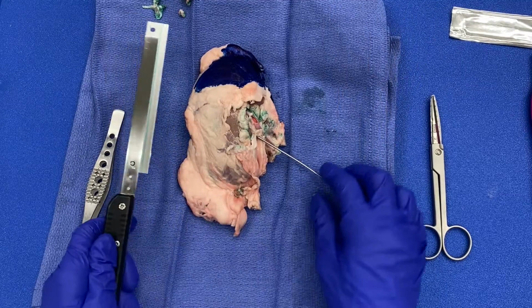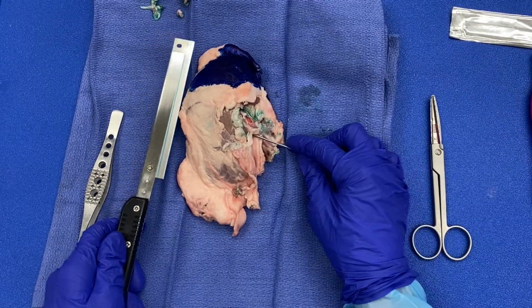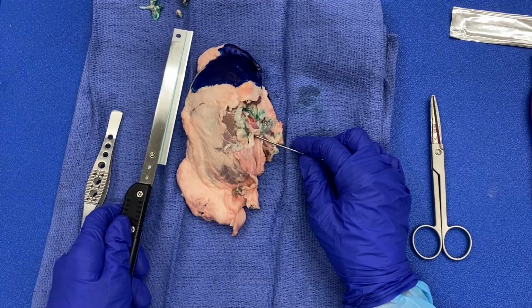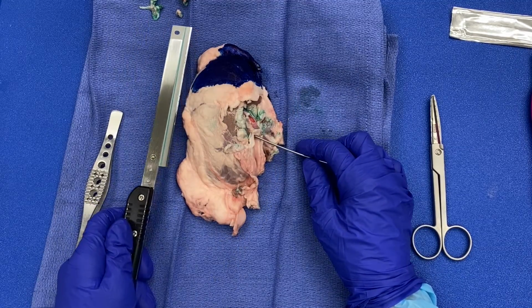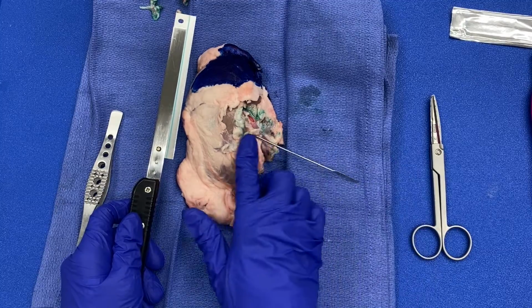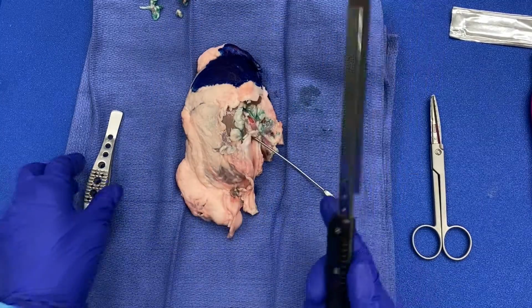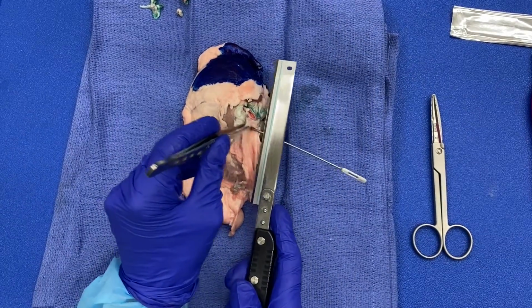However, there is such a thing as an anti-hilar approach. Some people will actually place the probe all the way through the kidney so that you're ensured that you've gone through the renal pelvis, and then you'll actually cut towards the hilum. That is called an anti-hilar approach, and that is something that typically can be done for tumors that originate in the epithelium of the ureter and renal pelvis.